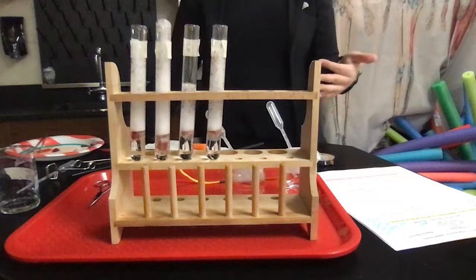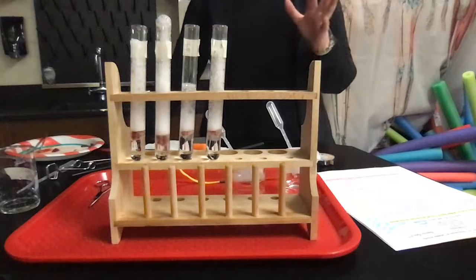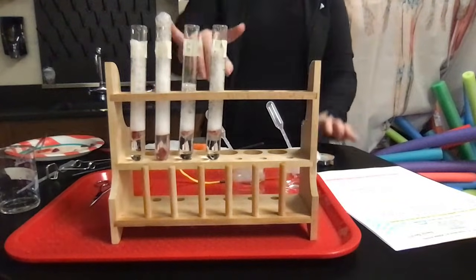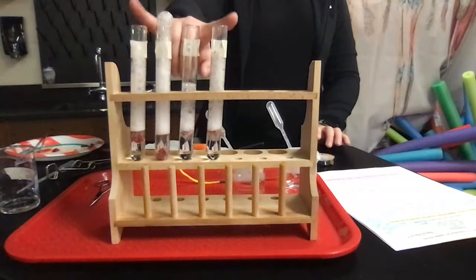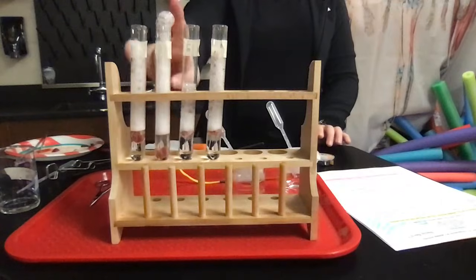But we can see that we at least have catalase activity; all enzyme activity is on a curve. So even though these are more extreme on the pH scale versus our 8 here, which is pretty close to the middle at neutral, we still see activity here, but it's not as high as number 3. That one was about a pH of 8, which is where it functions the best.